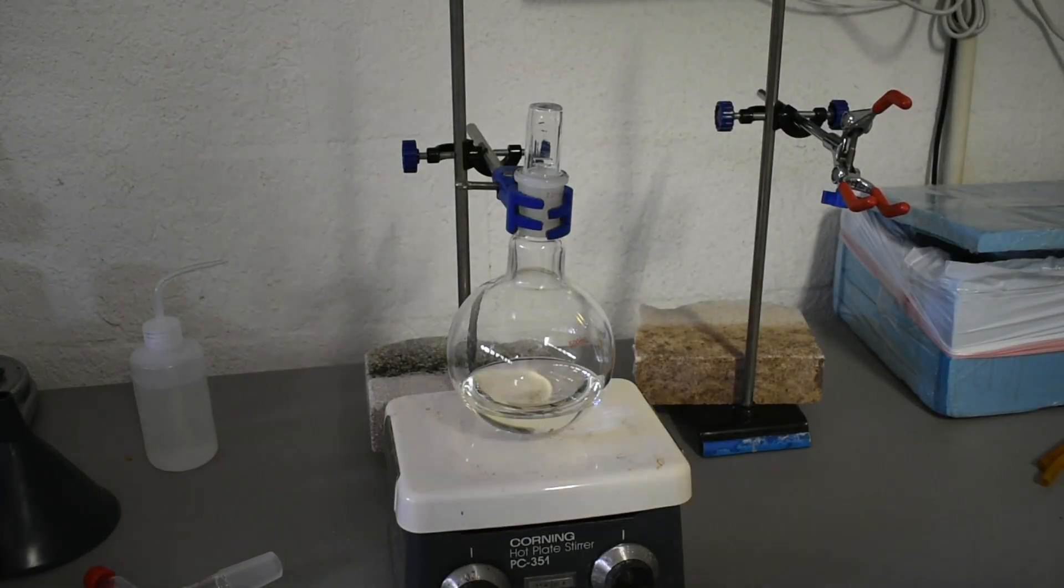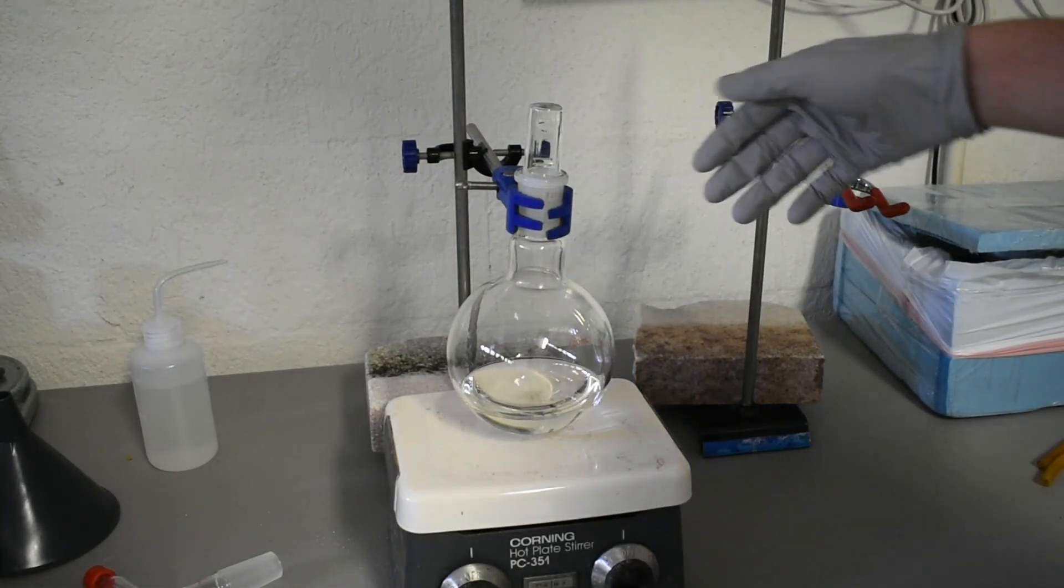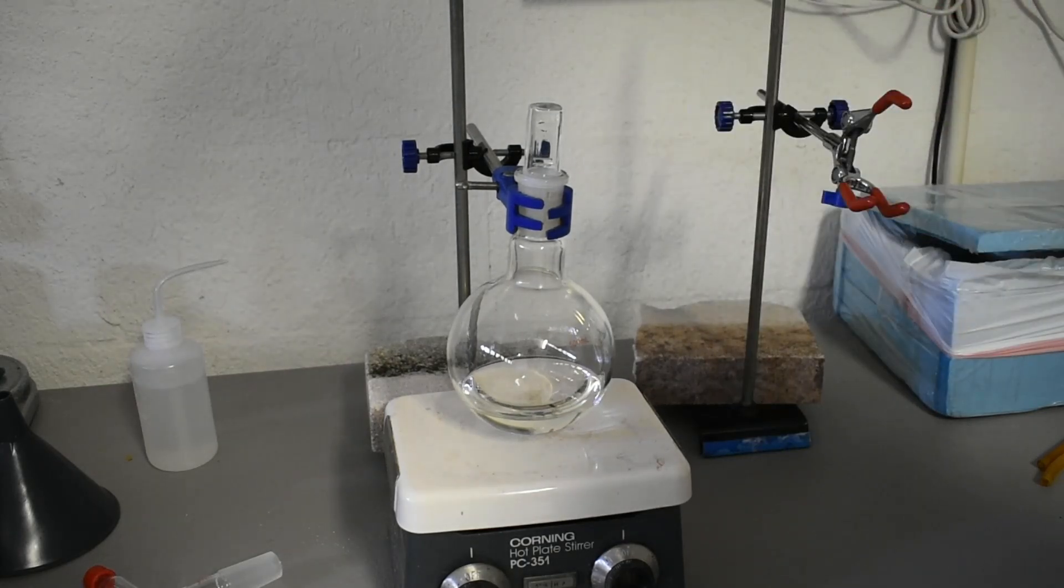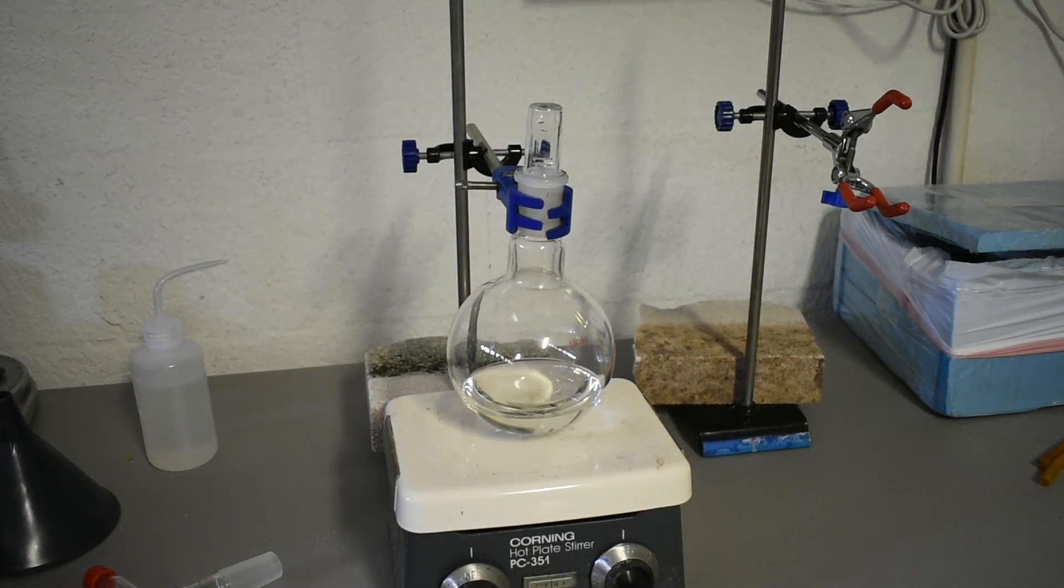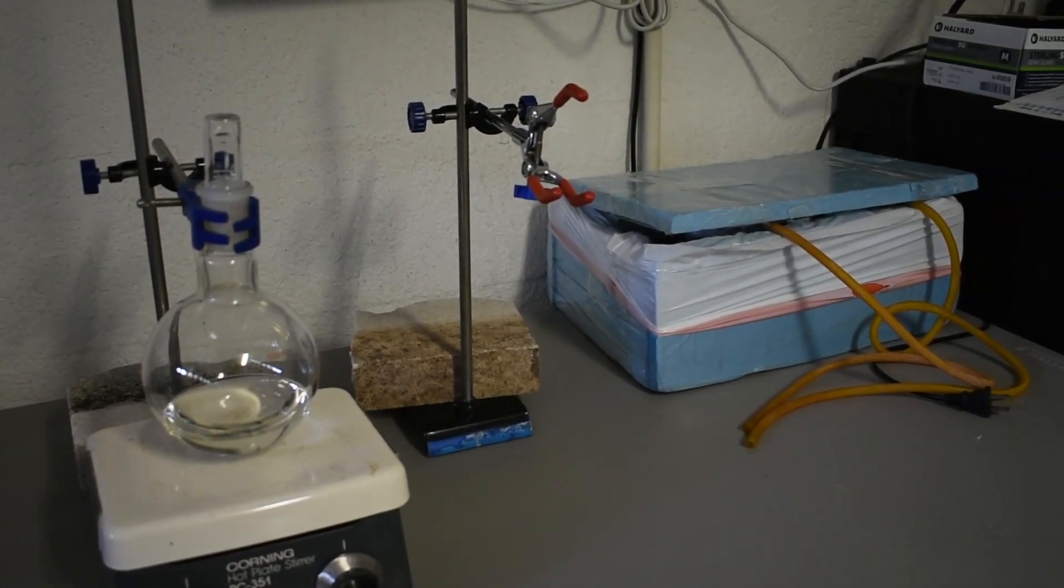Alright guys, next day. I got my pyridine here. All we have to do now is set up for simple distillation, and then we'll have our pure pyridine. I'm going to go ahead and set up the distillation apparatus. I'll probably time lapse that. Here we go.